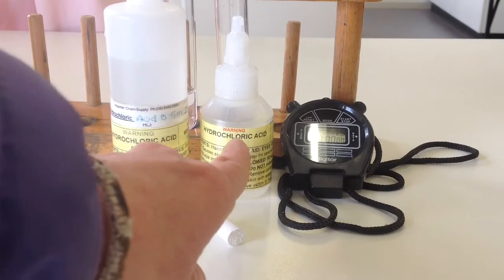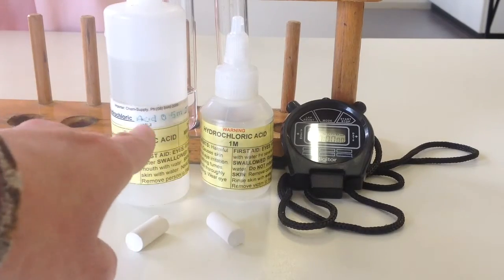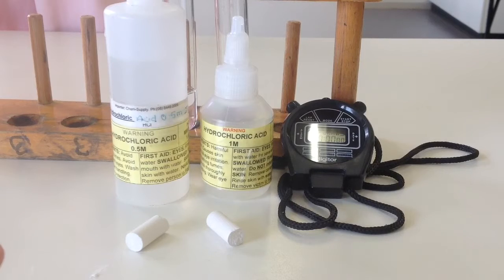Okay, you can see there's a warning on the labels because hydrochloric acid is corrosive, and if we get it on our skin or on the workbench, we need to wash our hands for about 15 minutes. Soap helps, and also with the workbench, a really wet cloth and some soap if it's a small spill. If it's a big spill, you'd come and ask me. Okay, and the other reason why we wear safety glasses is so that we avoid getting any of that chemical in our eyes, because remember, it's corrosive, so it wouldn't be a really good idea to get hydrochloric acid in your eyes.